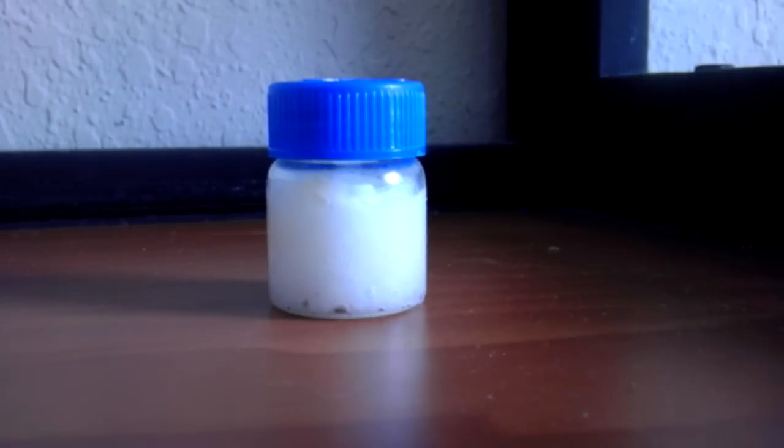Hello, YouTube. Today I'm going to show you how to make the sweet-smelling chlorobutanol. It's a pretty easy synthesis and a pretty interesting chemical. It has a nice smell to it. People say it smells like camphor.